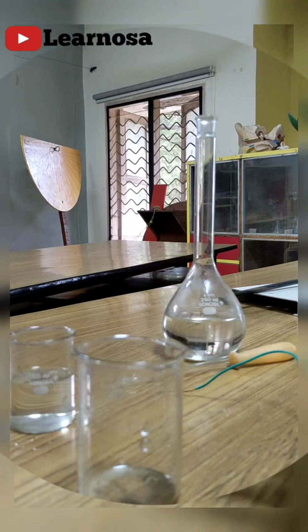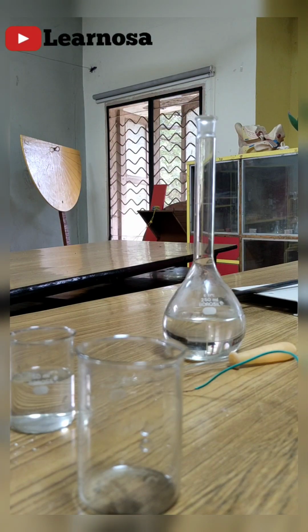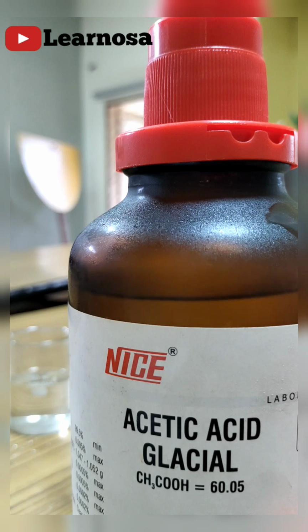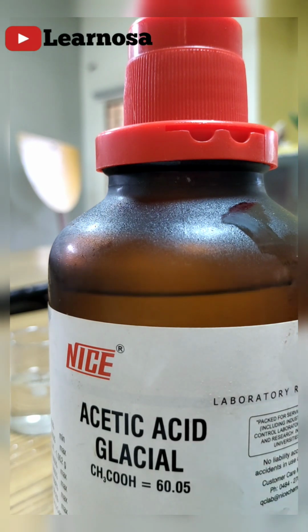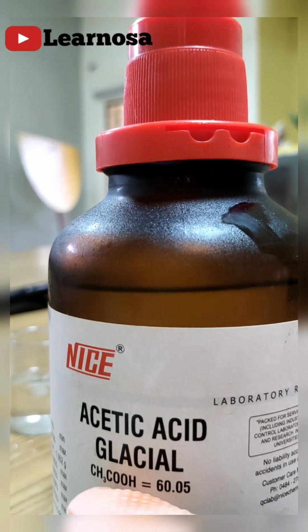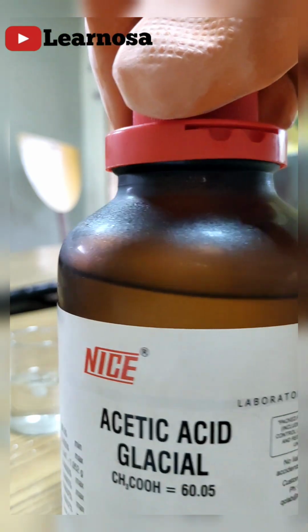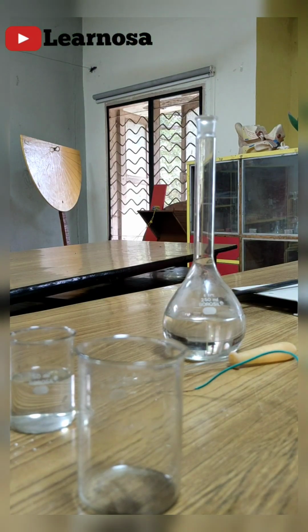In the first case we used hydrochloric acid. Now we are using acetic acid. This is the formula for acetic acid, CH3COOH. We will do the same experiment and find what kind of result we get. Does the bulb glow again? What do you think? Now you are watching the video, right? Comment whether it will glow or not, and if it glows, how it glows.